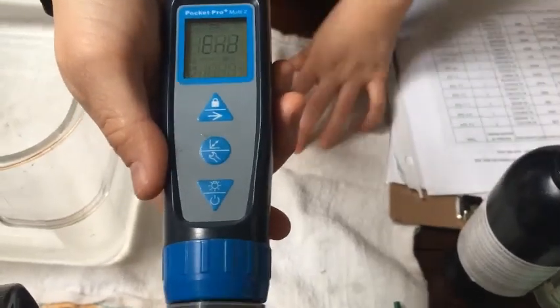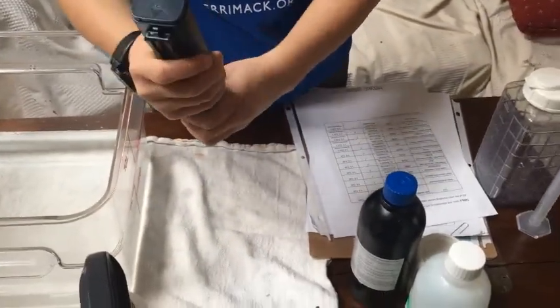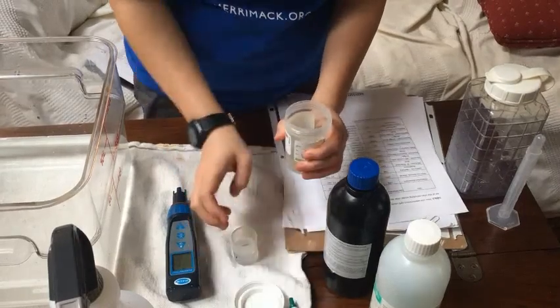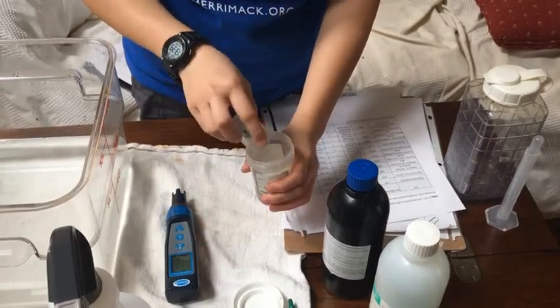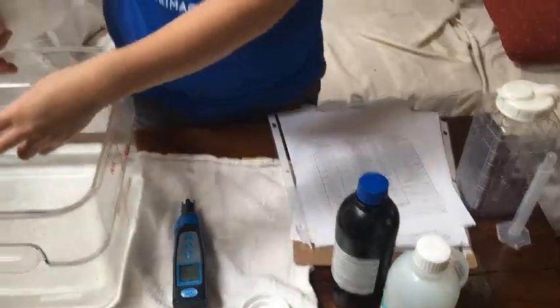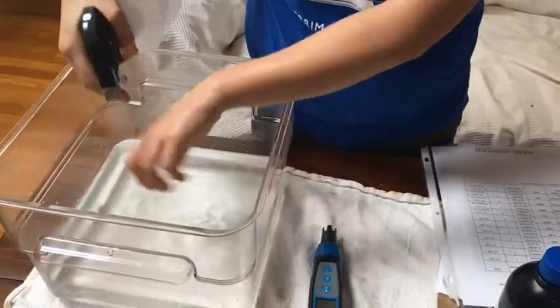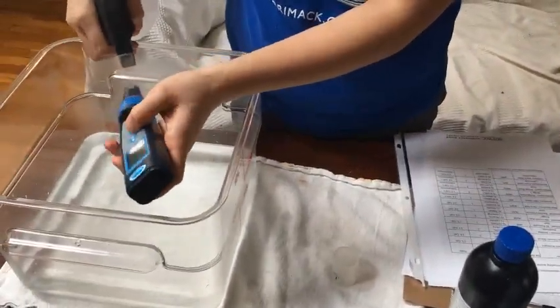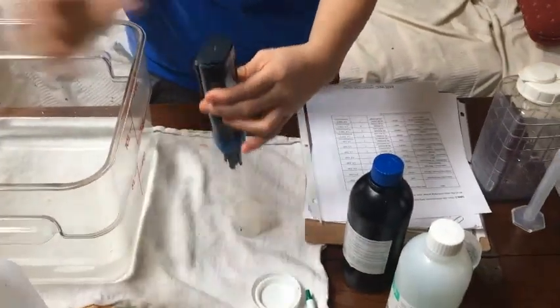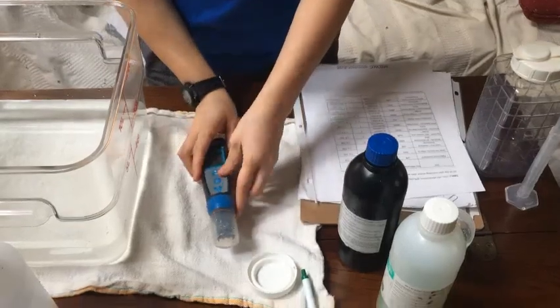You'll see 14, 13, and 'end.' Now you have both of them calibrated — both conductivity and pH. Remember to spray it down again. If you don't remember whether you've sprayed it down, it's better safe than sorry. And that's how you calibrate.